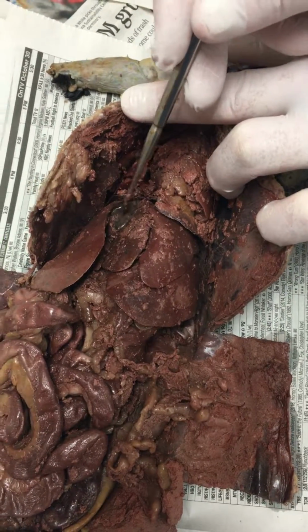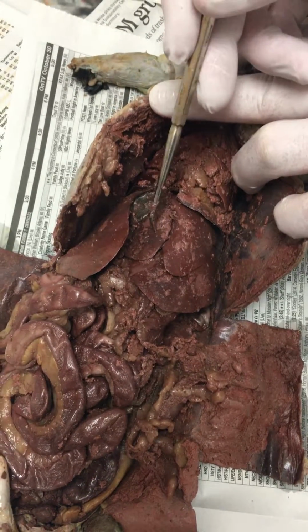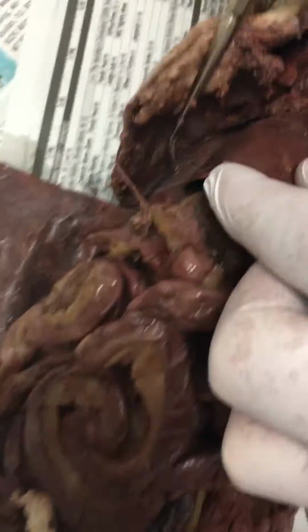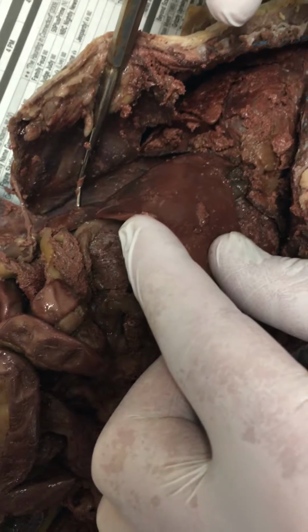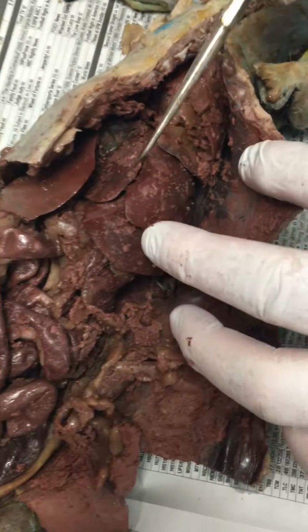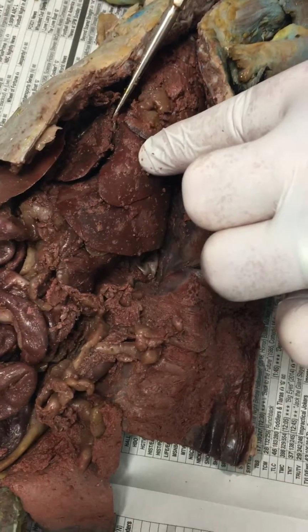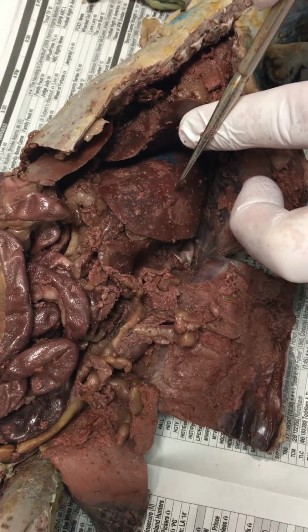The gallbladder always sits in the right median lobe. So all of this, including this piece right here, is the right median lobe. Lift it up and look underneath it. There's the right lateral lobe, right there where the probe is. Let it drop back down. Go past the next cut. That's the left median lobe. Lift that up, left lateral lobe.